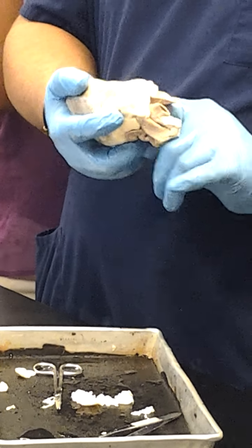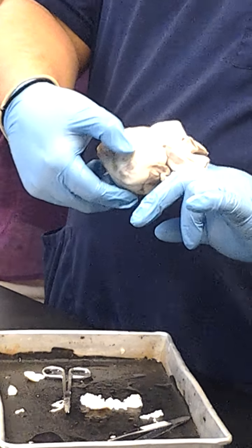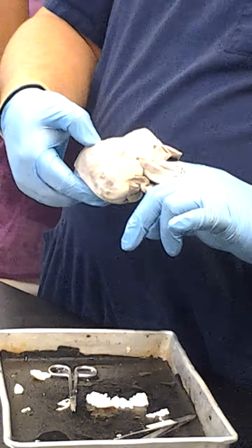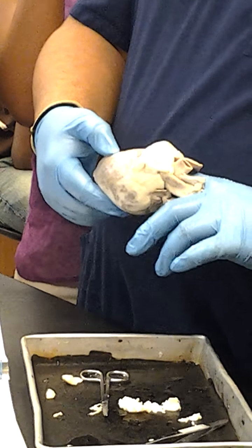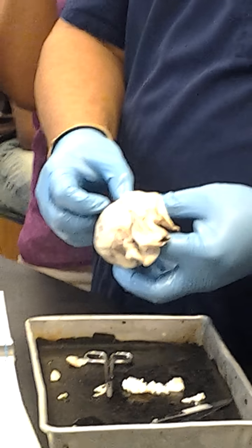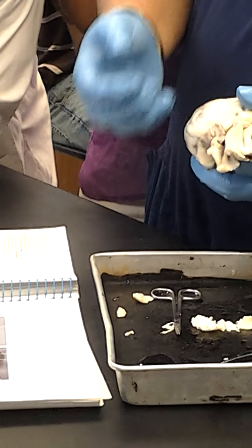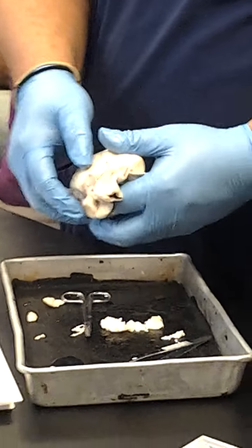So right there, you can see this is where the right ventricle ends. So right at this blood vessel right here is going to be the interventricular artery and vein. So right here, going across like that. So that's where the great cardiac vein would be, or the anterior interventricular artery would be right there. And then if you go this way, you'll see that it basically stops over here.